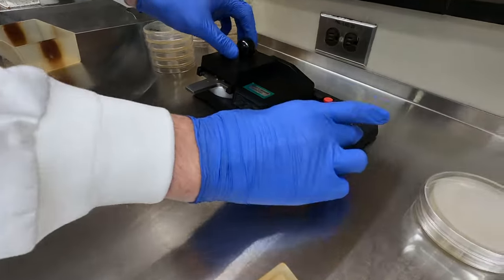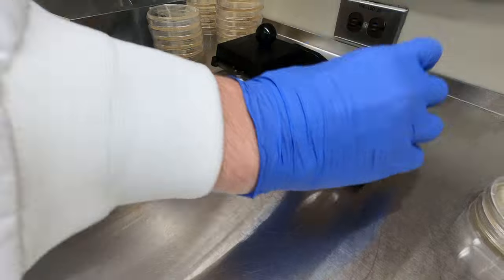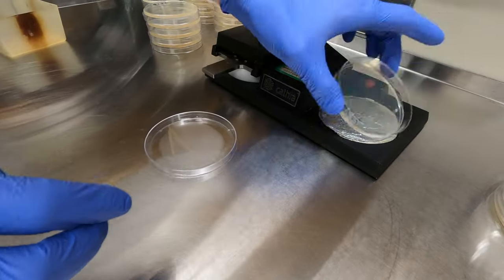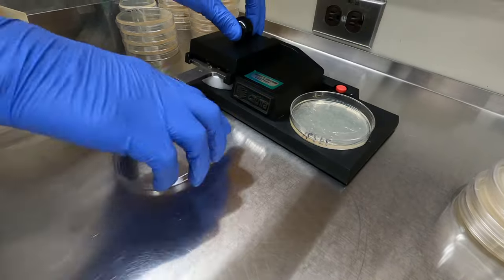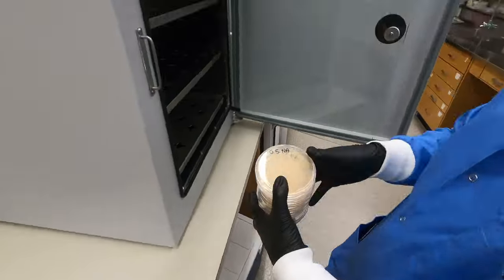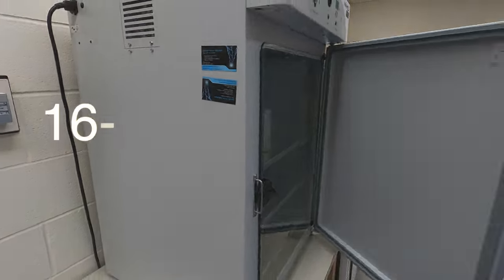These plates are then allowed to sit right side up for 10 to 15 minutes so that any liquid can absorb. We then turn them upside down and incubate them overnight at 35 degrees Celsius.